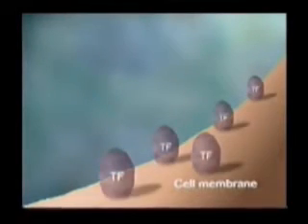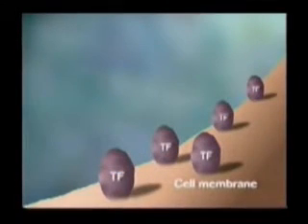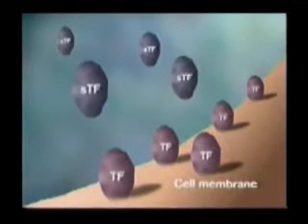In the body, TF is firmly planted in the cell membranes of vascular tissues, and that makes studying it a bit tricky. Fortunately, a synthetic version of TF that is soluble in water has been developed. This protein is called soluble tissue factor, or STF. We can use STF to learn something about the way TF binds with 7A on the surface of cell membranes.